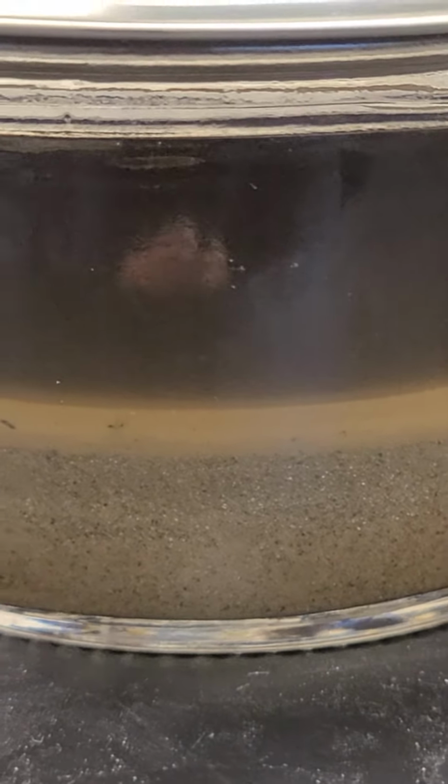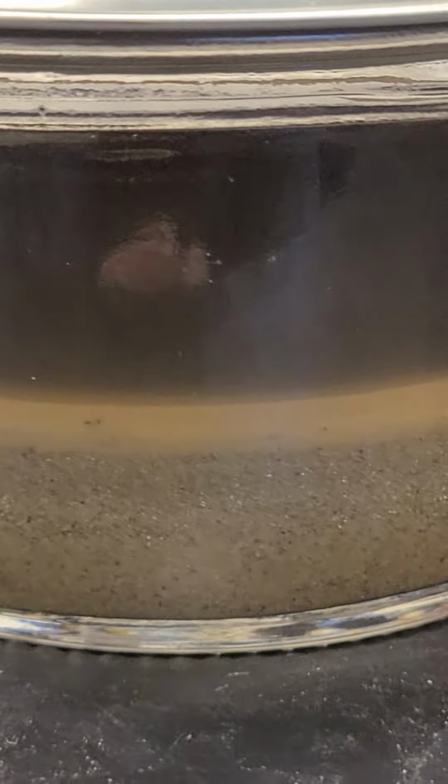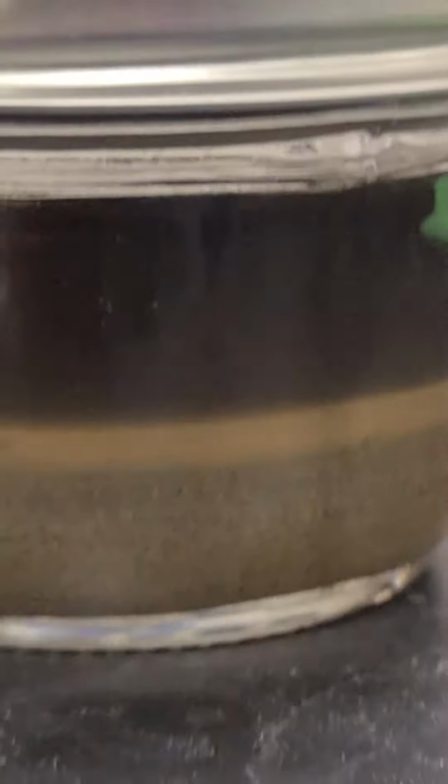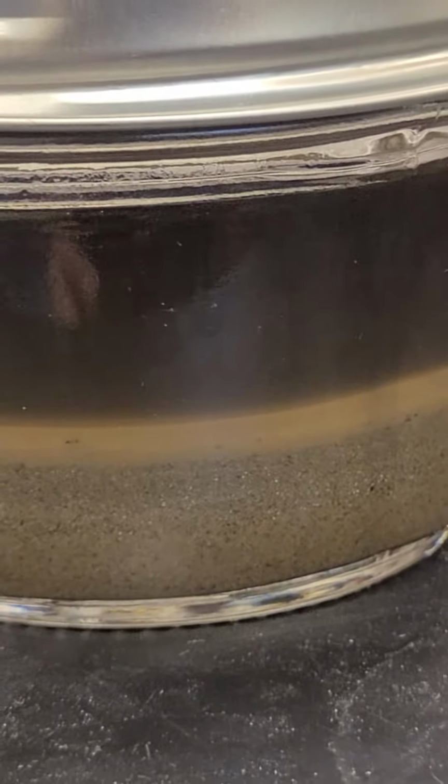I am in my classroom and I'm looking at a soil sample from my yard from last year. And I hope as you look at this, you can see three distinct layers. This is after I've dried the soil, I've added the detergent, I've shook it up, and then it's actually set for over a year. In your case, about 48 hours would have sufficed. So what do we do with this information?